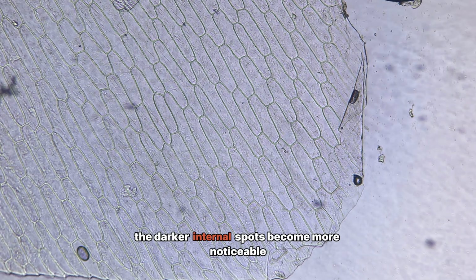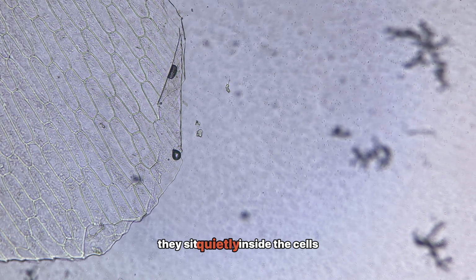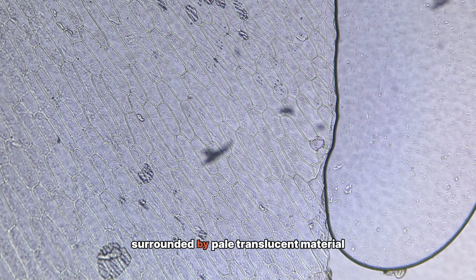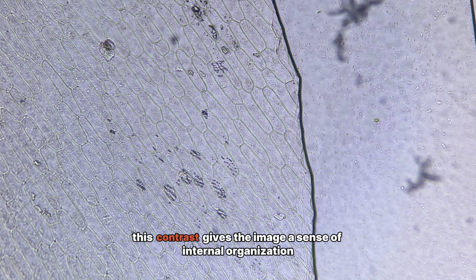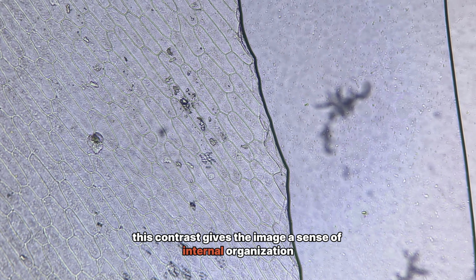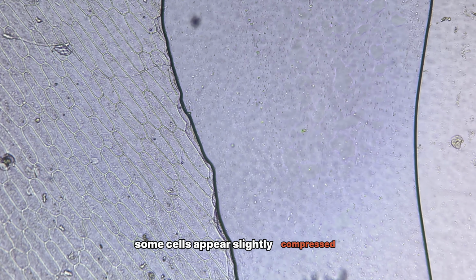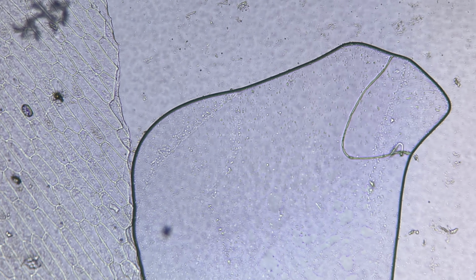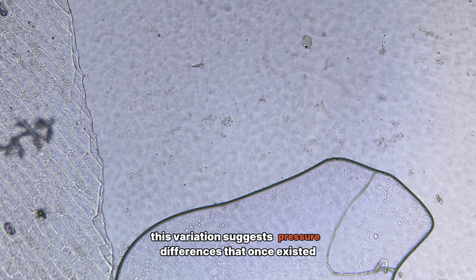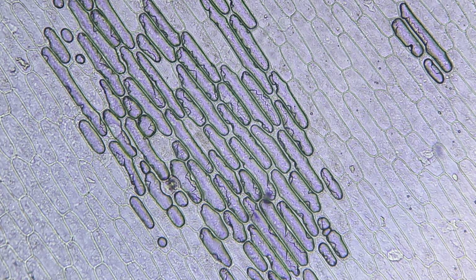The darker internal spots become more noticeable. They sit quietly inside the cells, surrounded by pale, translucent material. This contrast gives the image a sense of internal organization. Some cells appear slightly compressed, others seem more open and relaxed. This variation suggests pressure differences that once existed inside the living tissue.